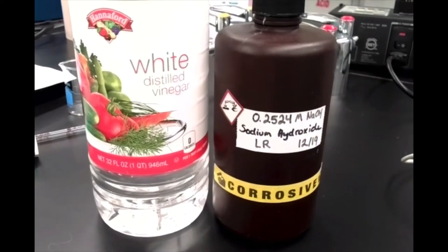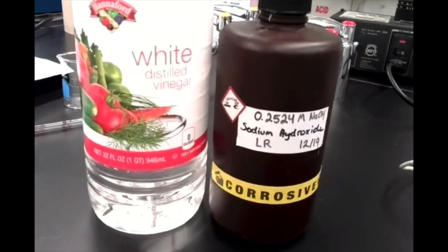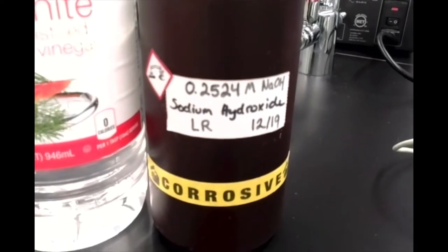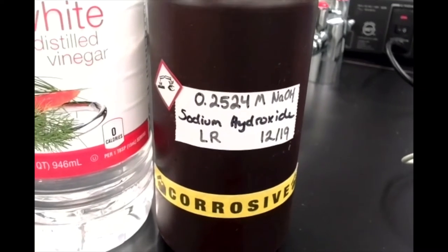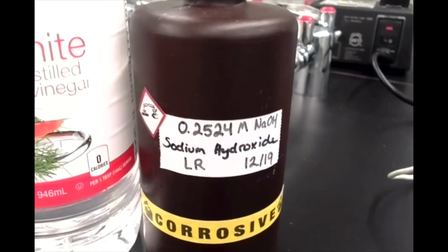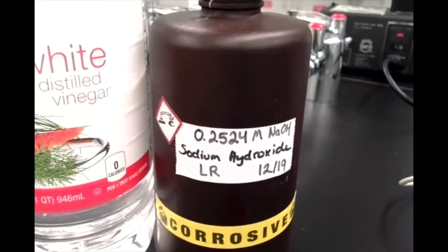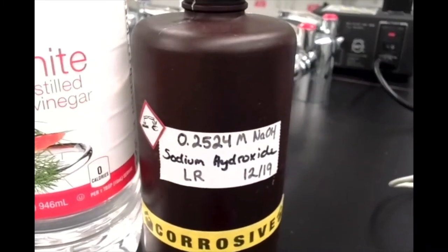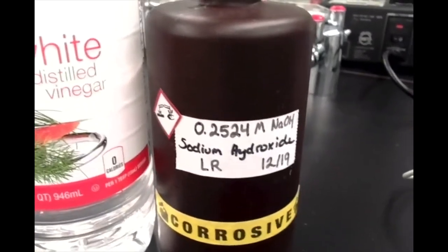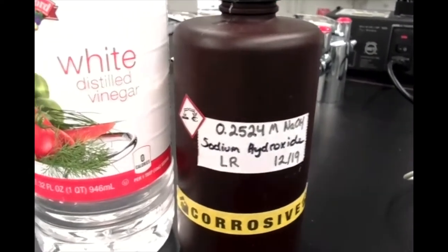In order to do our calculations later on, we're going to need to know the concentration of sodium hydroxide we're using. So please make a note of the molarity of sodium hydroxide labeled on the bottle — that's going to come in handy when we start trying to figure out the concentration of vinegar. In this lab, we're going to figure out both the molarity of acetic acid in vinegar as well as the percentage mass per volume.